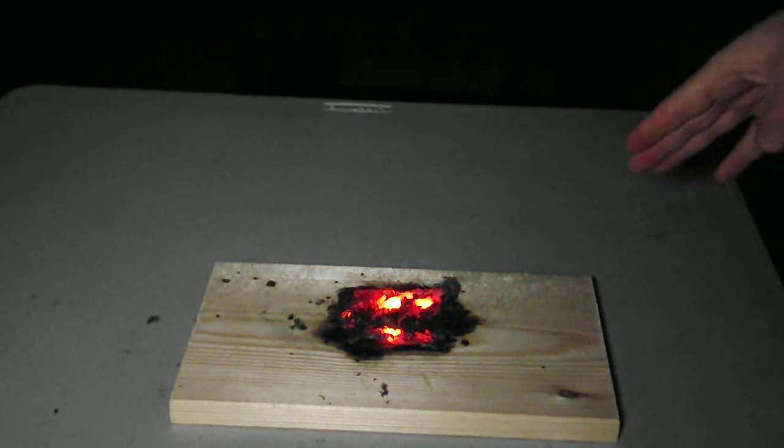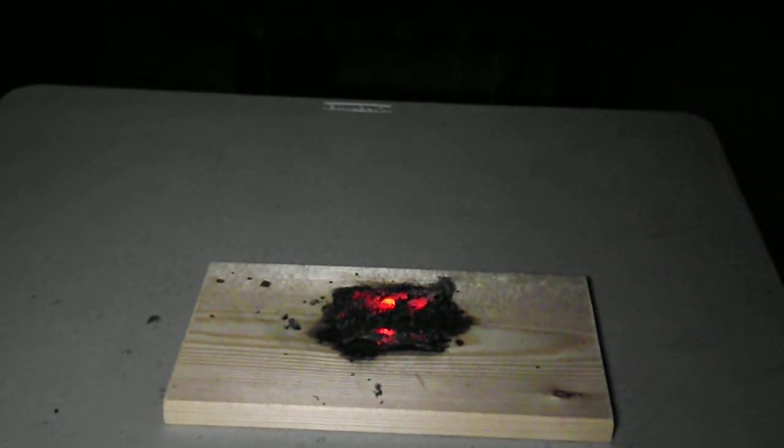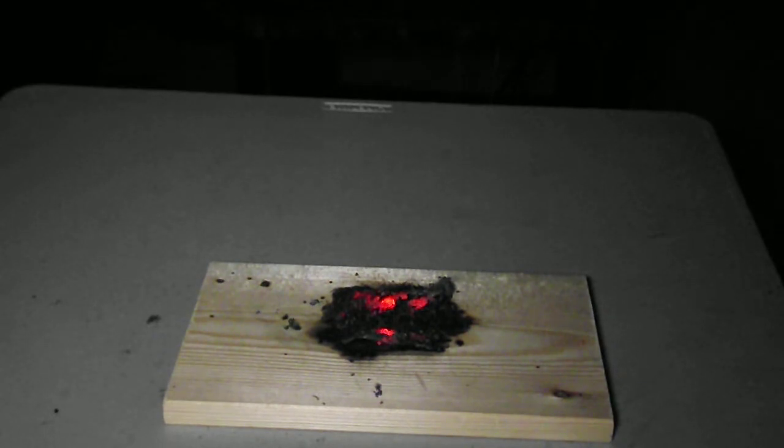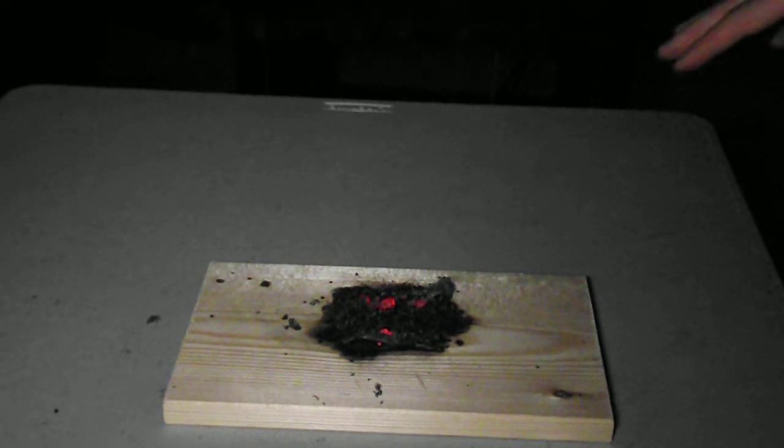It will eventually go out — there are fire extinguishers around. If you look at it, it's actually glowing. I've converted some of the iron into iron oxide, but the rest of it — that heat energy — has been used to actually melt the iron that's there. So I've actually got molten iron up here on my board right now.